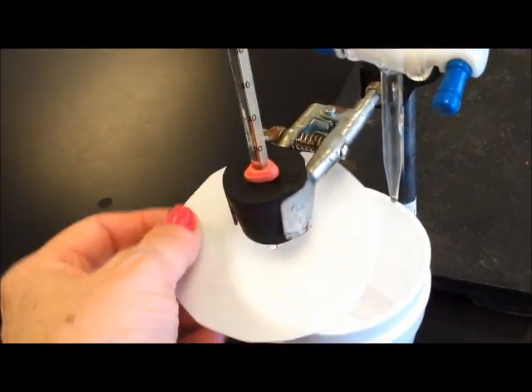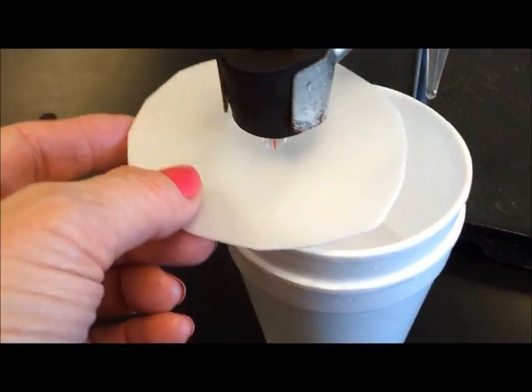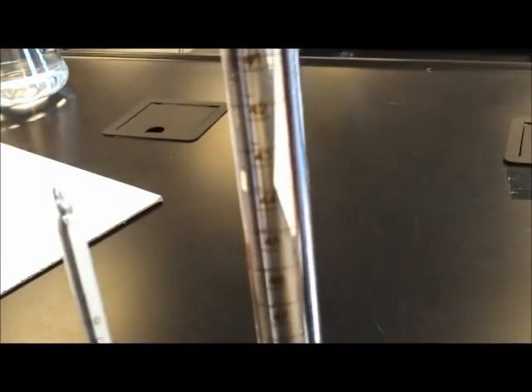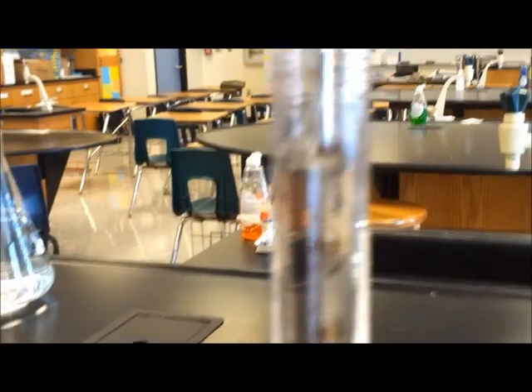We are going to place more or less five centimeters cubed each time and wait for the temperature to stabilize. Read the temperature and record it.